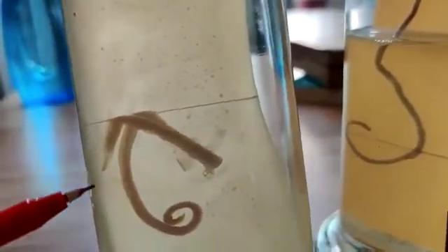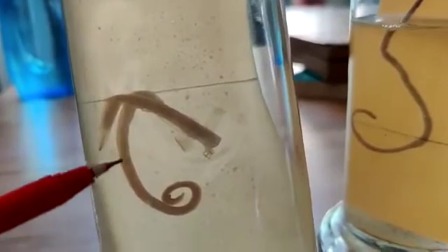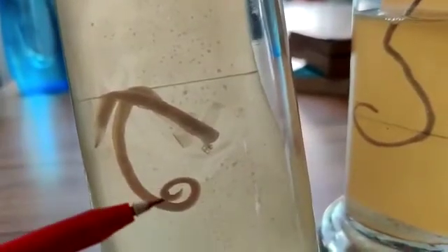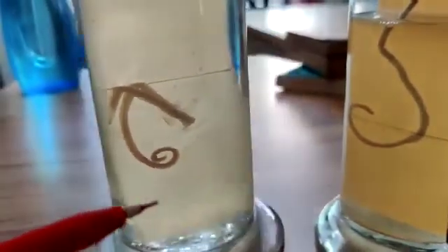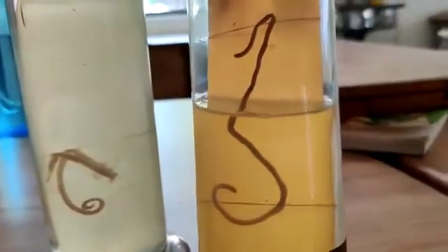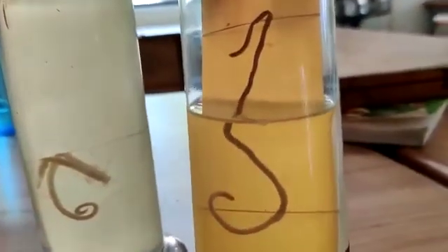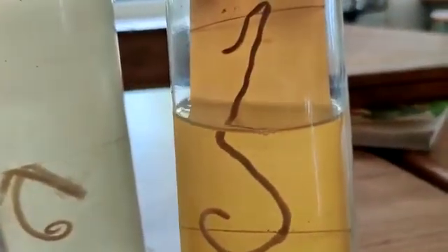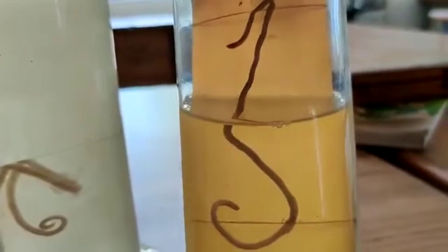In the female, the posterior end is straight, whereas in the male the posterior end is curved. Here in another specimen also, you can see that the posterior end is curved, so it is also a male Ascaris.